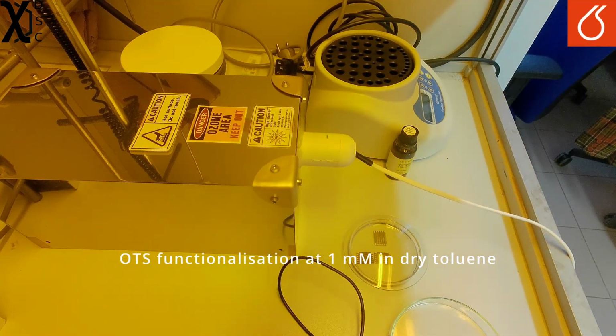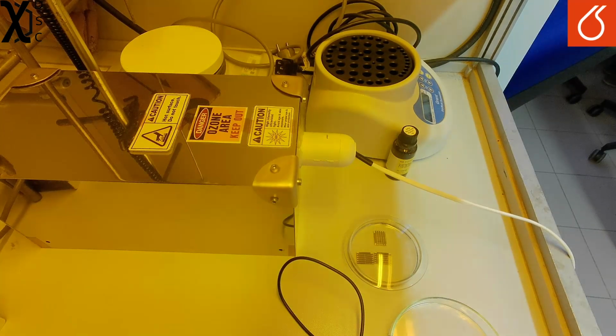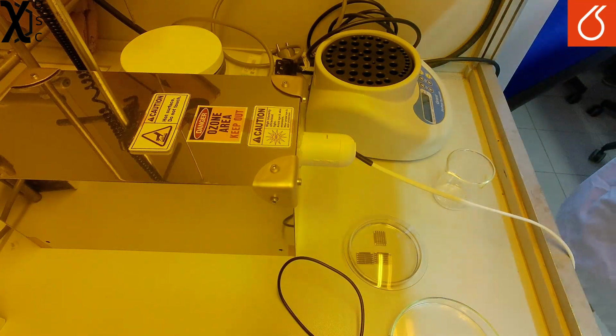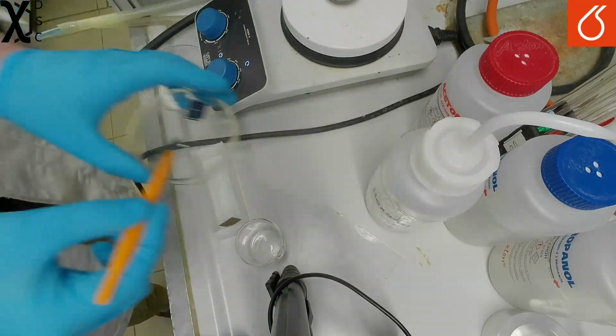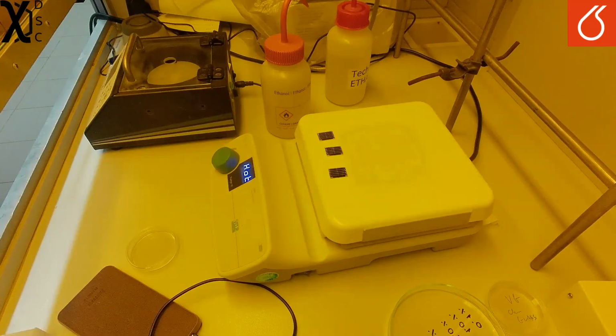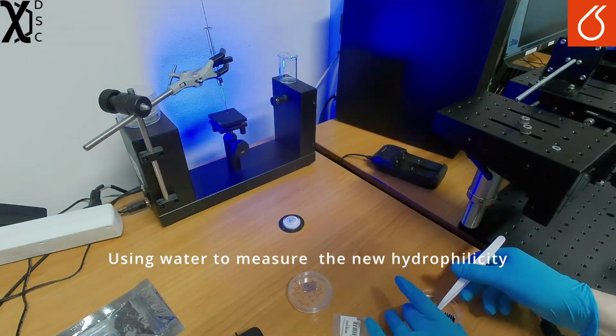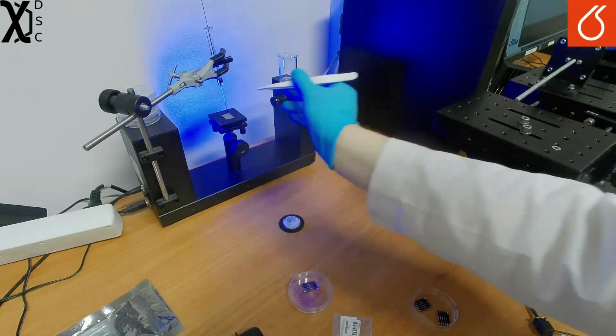Subsequently, a 1 millimolar solution of OTS in dry toluene is added to the substrate, and it is left there for 20 minutes. The solution is then poured away and quenched with water before being disposed of. The substrates are then washed with hexane and finally thermally annealed at 150 Celsius for 5 minutes. Then the OTS functionalization is complete, the hydrophobicity is increased, and they work better as OFETs.